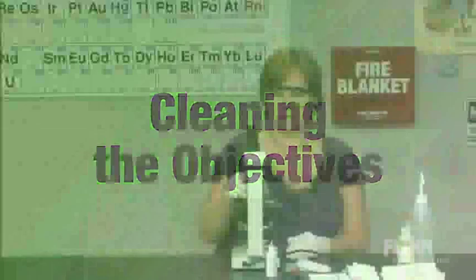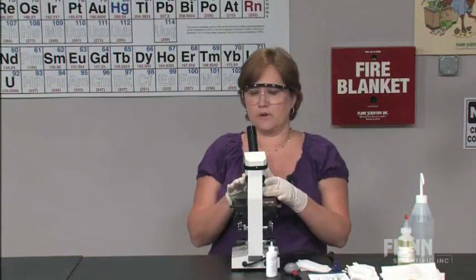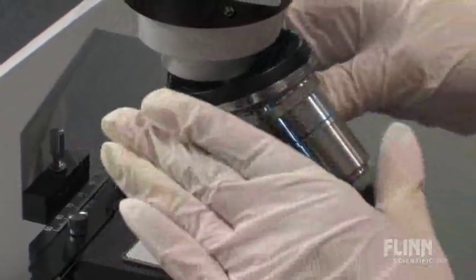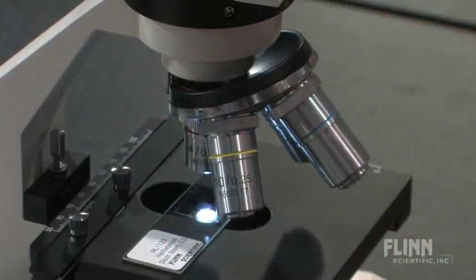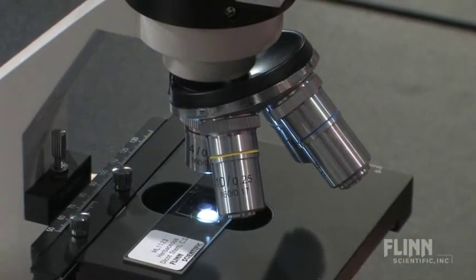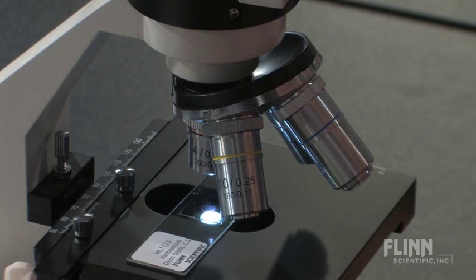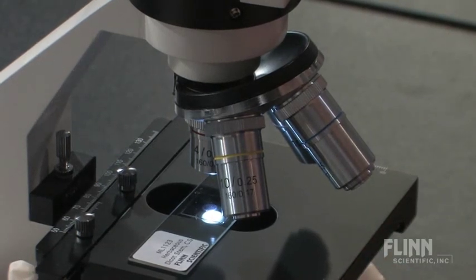Moving to the objectives, you're going to start with lowest magnification. Rotate that into focus, focus the slide, then move the slide.